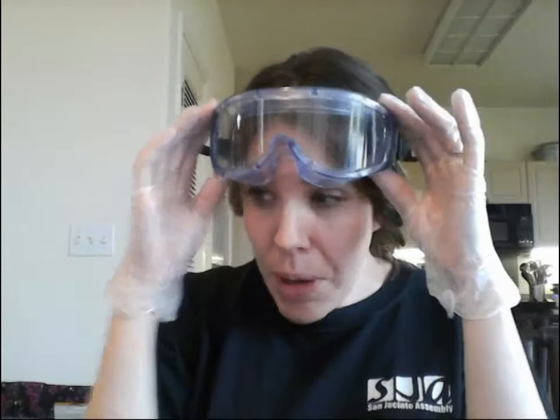Don't put them on backwards like I just did. You're going to want to have your lab goggles handy. When you're actually looking through the microscope, you don't want to wear the goggles because it'll be hard to see the image well. But when doing things like staining the slide, you're going to want to wear them. You should also wear your lab coat. I forgot mine, but you should wear the lab coat that came with your PPE set, and I'll have you take a picture of yourself following all lab safety procedures including wearing all your PPE.